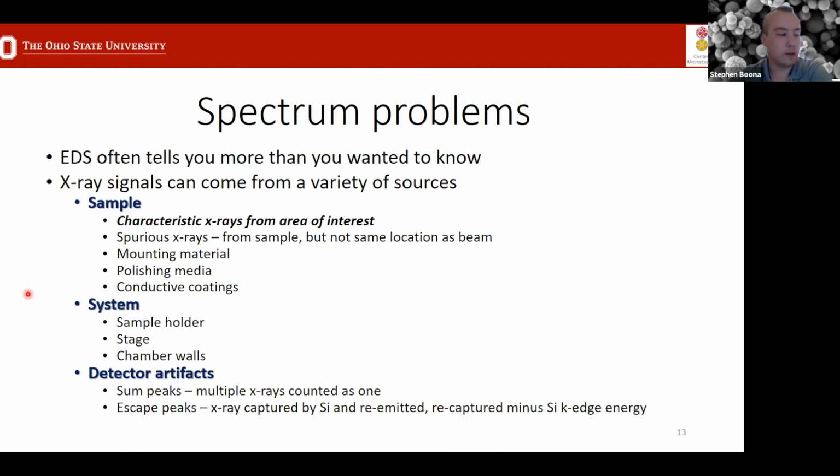Two that are especially well-known and common are what are called sum peaks, where two X-rays are counted essentially as one because of the timing between when they hit the detector. And then escape peaks as well, where essentially you have a peak located just slightly away from the characteristic peak you're looking for, but differentiated by the fact that it was absorbed and then re-emitted. So those are all different reasons why you may have some issues with the peaks that you're looking at in your spectrum.